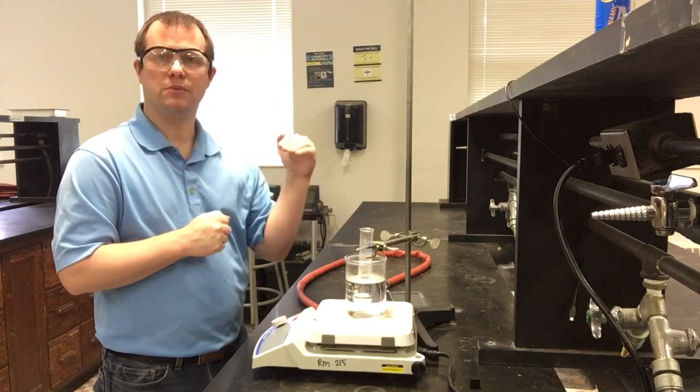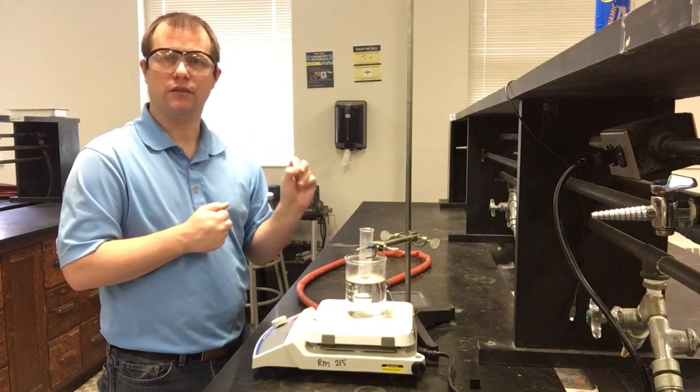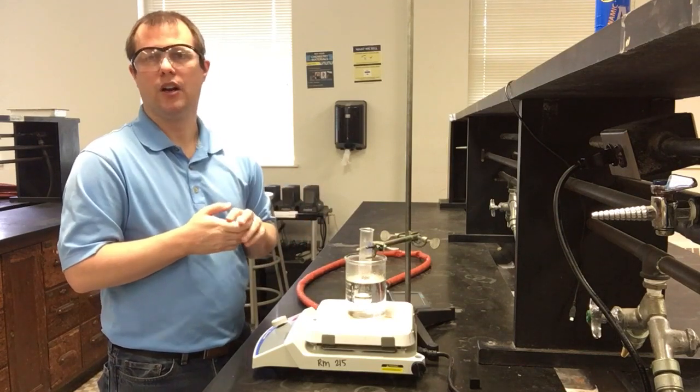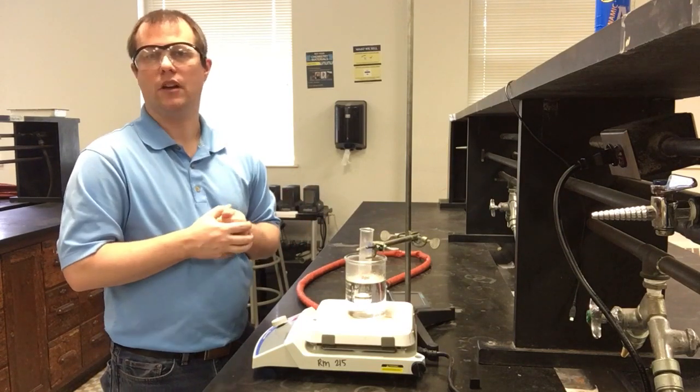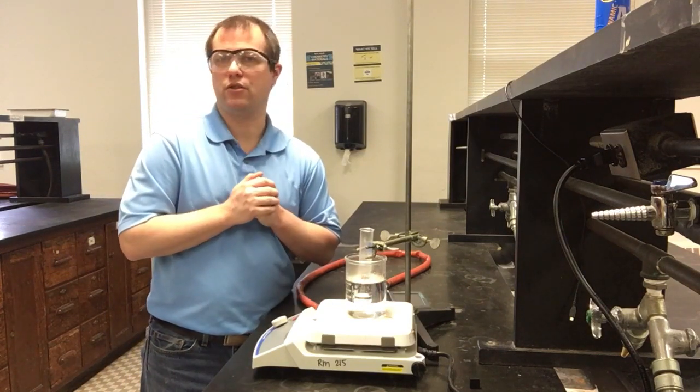From that, you guys will be doing calculations to find the freezing point depression constant for naphthalene itself. Then we use that constant in the third part of the experiment, when we're going to add an unknown compound to our naphthalene test tube, and then we're going to see what the new freezing point is with that unknown compound.